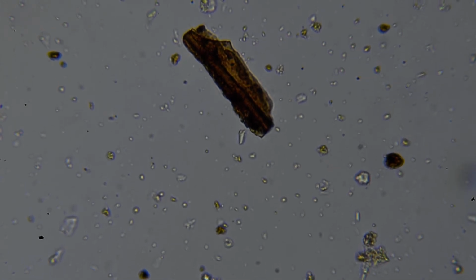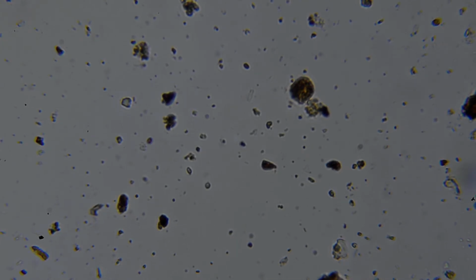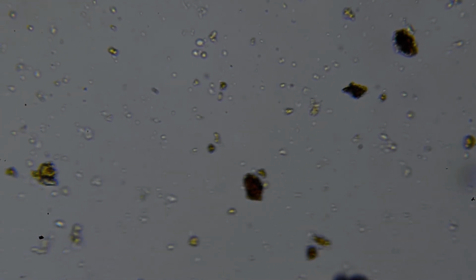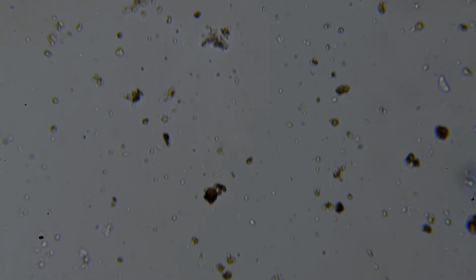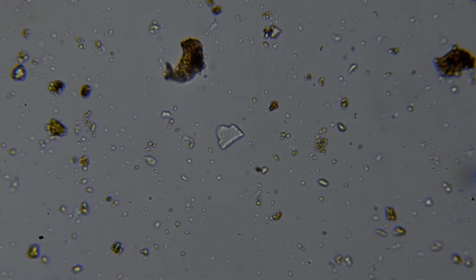Okay, so let's keep having a wee scan. All these little transparent things that have sharp, jagged edges are not organisms, they're all minerals, like I was saying before. So there'll be your sand, silts and clays, silica. You can see a lot of silica around here, as you would expect, because we know there's a beach under here. And we're right beside the sea. There's a big bit of silica right in the centre there. That's just a piece of glass, essentially.